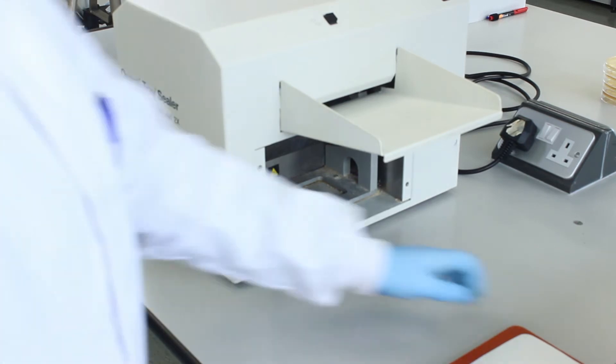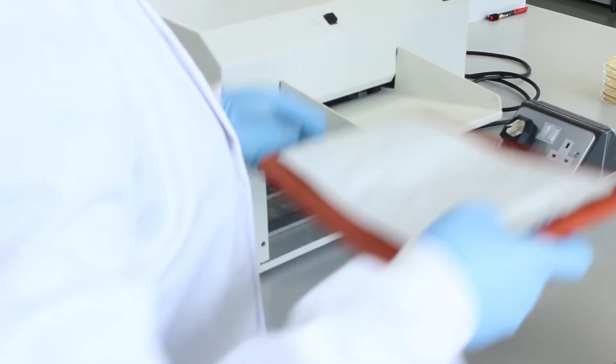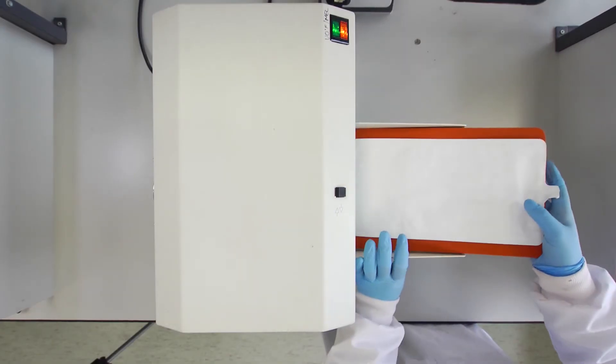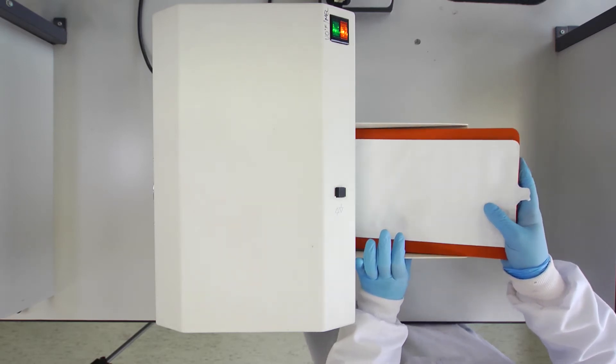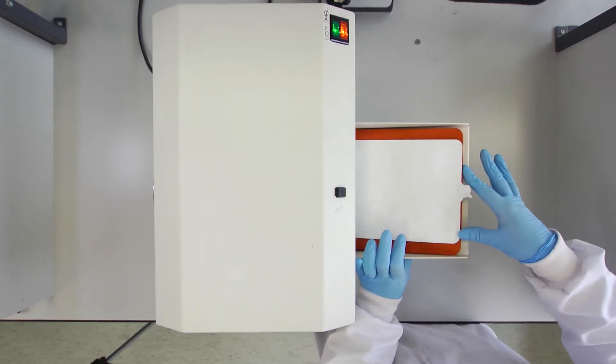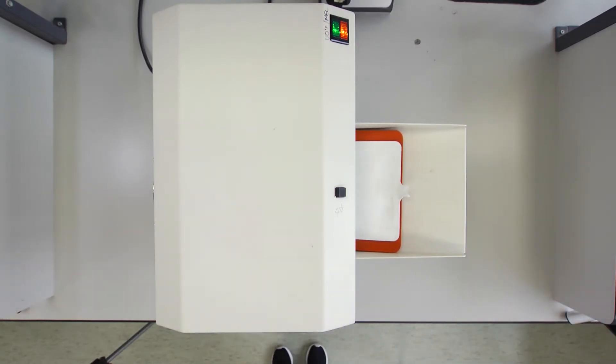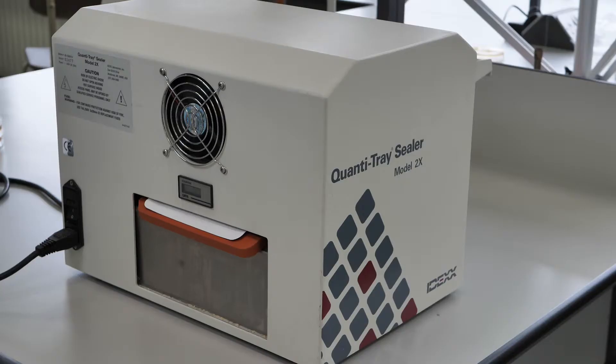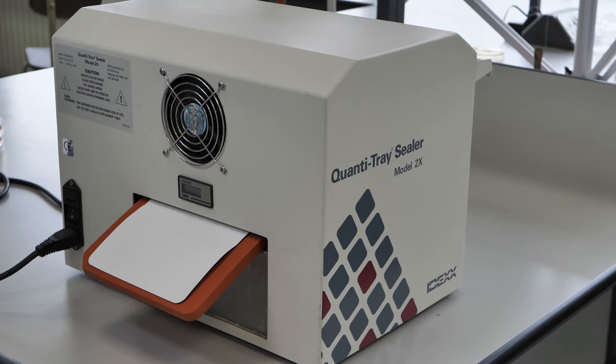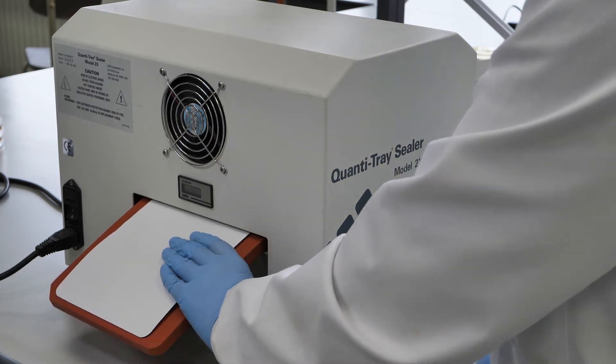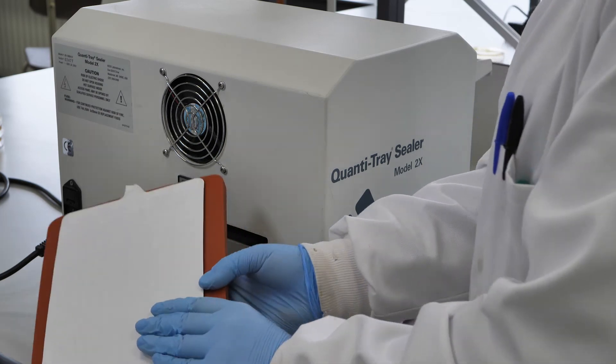Seal the tray using the Quanti-Tray sealer. Once sealed, the tray is incubated at 37 degrees for 24 hours.